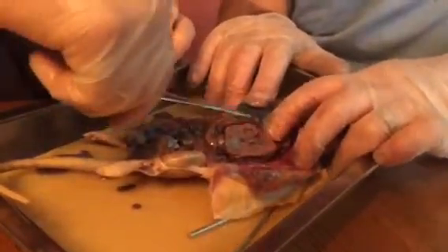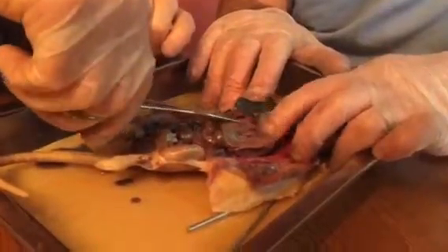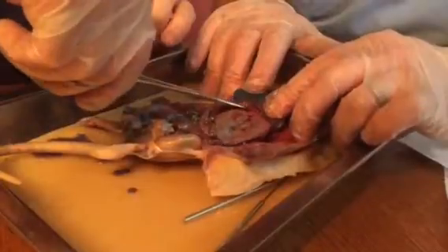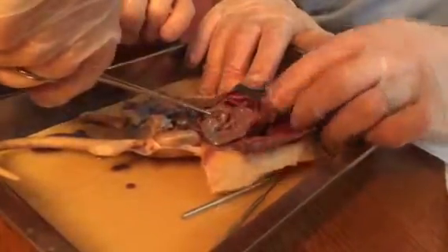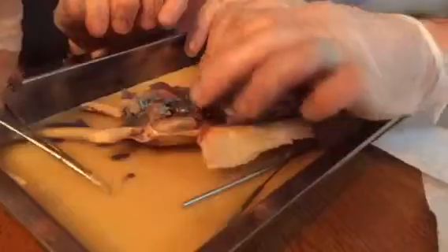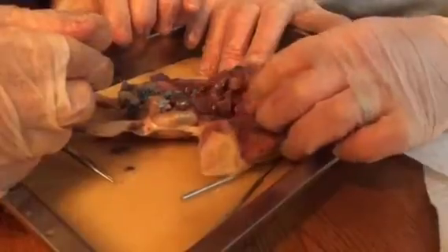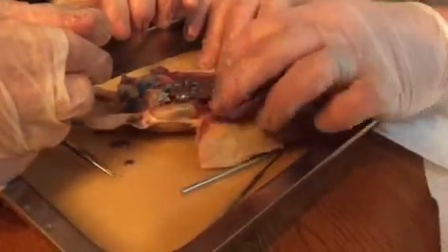Look at that. And this is the jejunum. Or no, I think the jejunum's first. I can't remember now. The small intestine, yeah. Large intestine. So the large intestine folds over like this, and it should be the ascending colon right here. That's a big part coming up. Transverse colon's here. Then the descending colon goes down to the rectum.